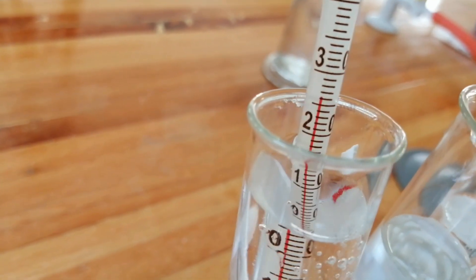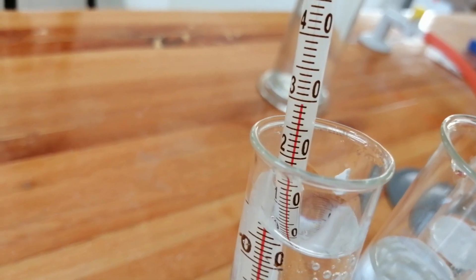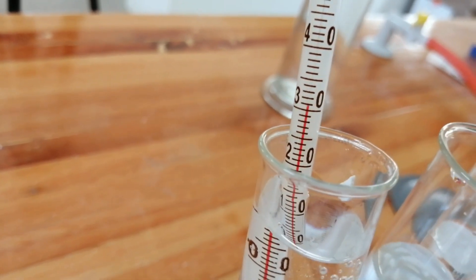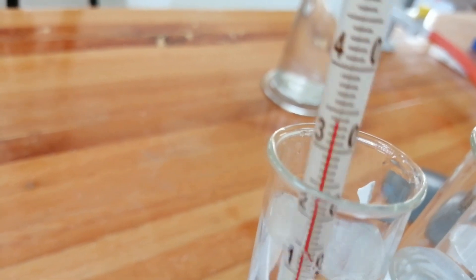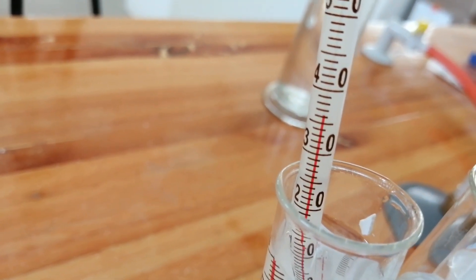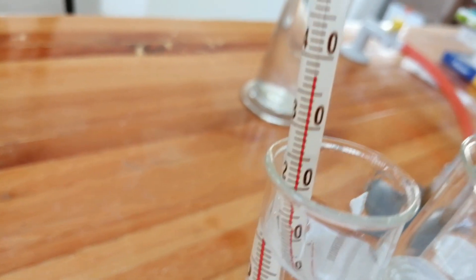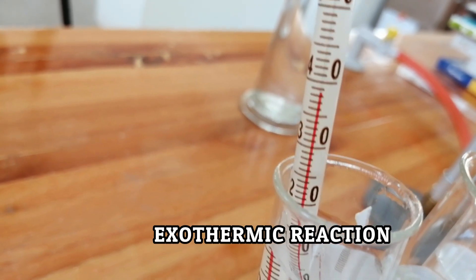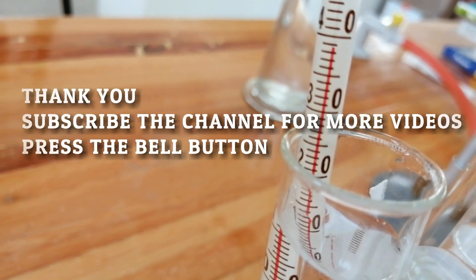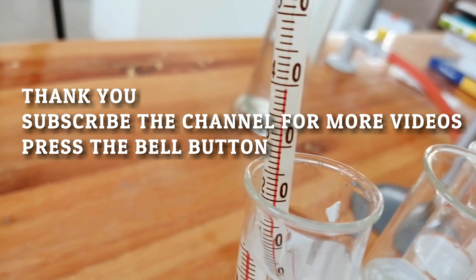You could see that the temperature is going up — yeah, now it's 30 degrees, 31, 32 — the temperature is shooting up! This shows that the reaction releases heat. This is an example of an exothermic reaction in which the particles release heat. These two are very good examples, and all these chemicals are available in any school laboratory, so teachers and students can enjoy this experiment.